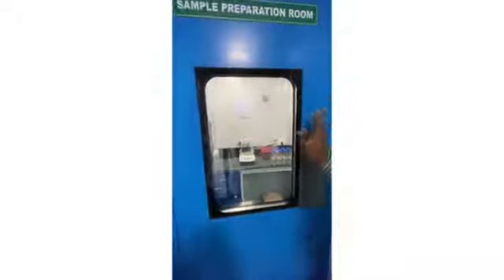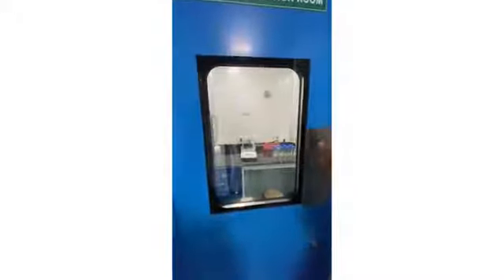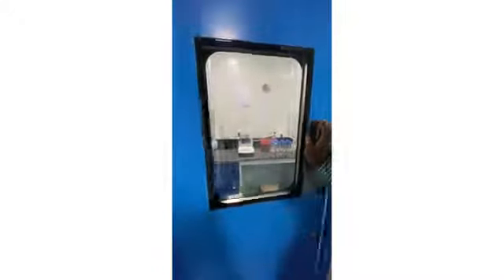After sterilization, we are taking those media and glasswares to here through that pass box. Pass box is there from that side. And here this is sample preparation room. This is mainly used only for sample preparation. Nothing activity done here. After preparation of the sample here, we are keeping for mixing with that equipment. Like this.